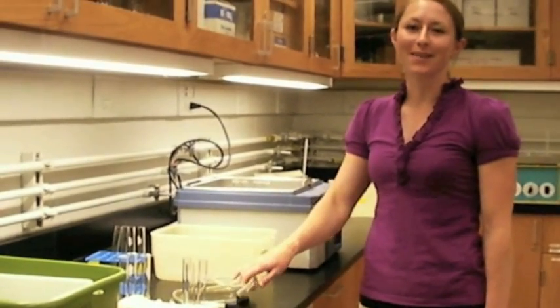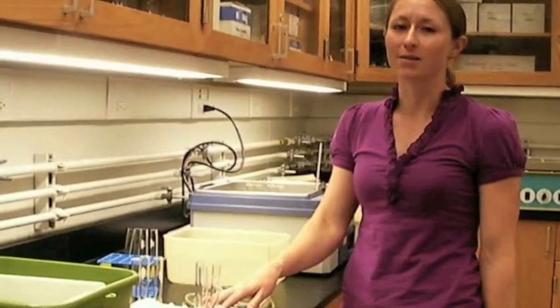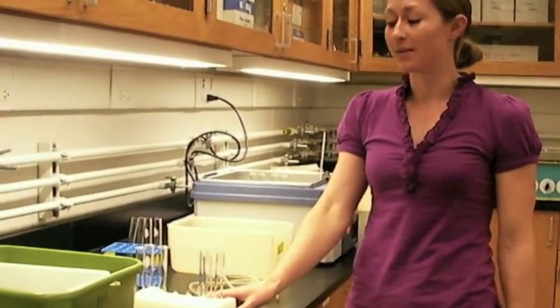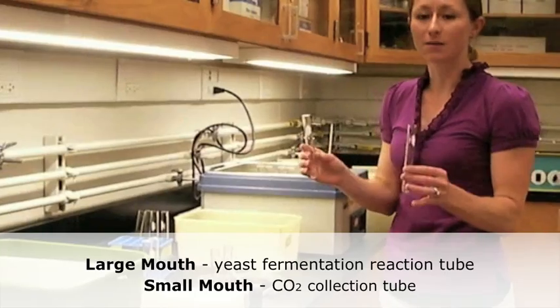This is for Ball State University Biology 111 lab, and this is the fermentation and cellular respiration lab setup. With this particular lab, there are two different test tubes that we're using.